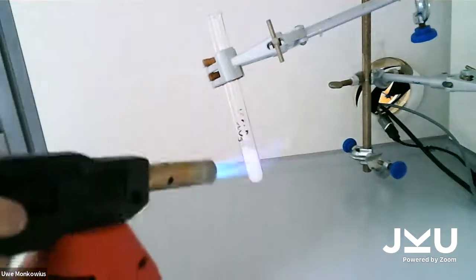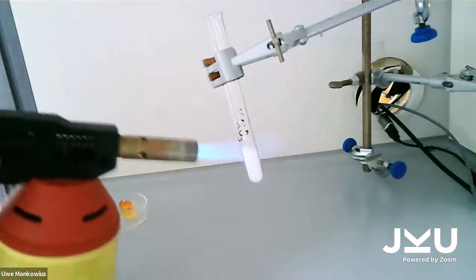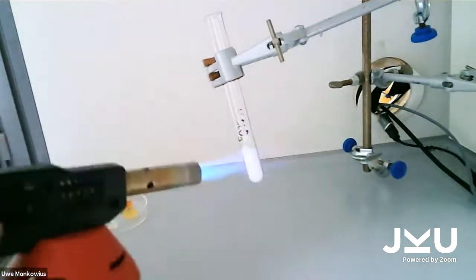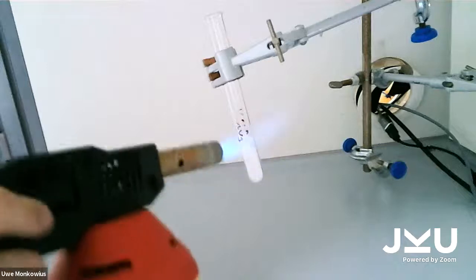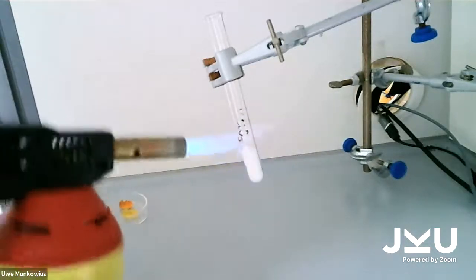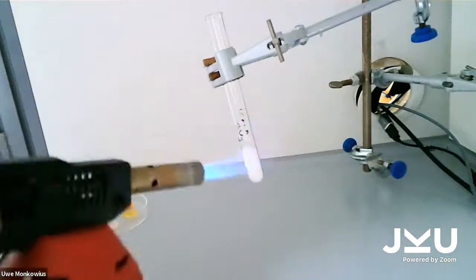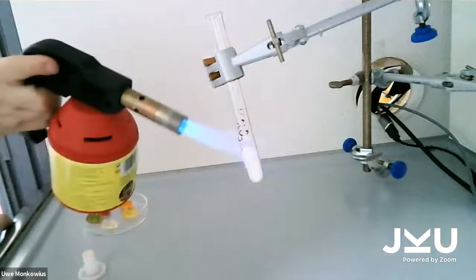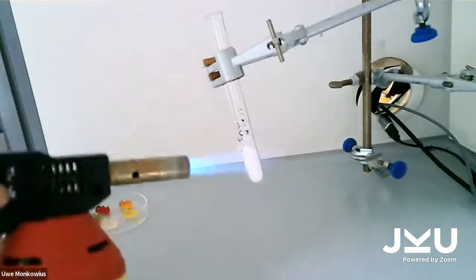When you heat something up, a tube or something, always try not to put the heat only on one spot. Stuff expands when you heat it up, and if you don't heat it up properly, the stuff may break. So always try to heat up glass and similar stuff not only on one spot.